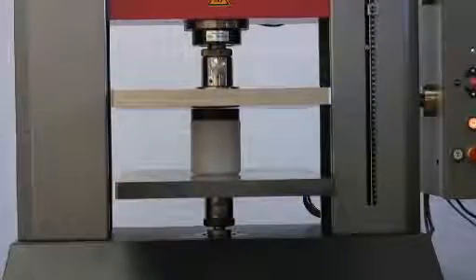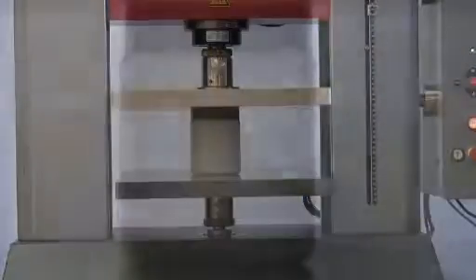The forces exerted during the test are displayed on a computer. This equipment is capable of forces up to 20 kN.